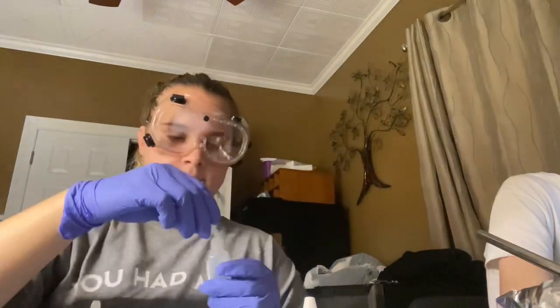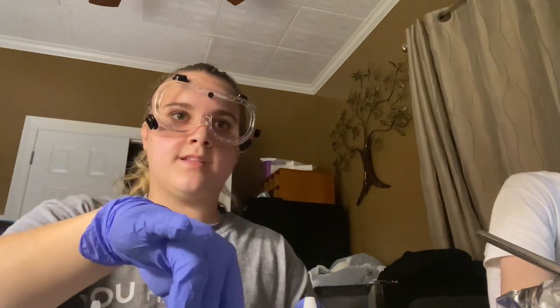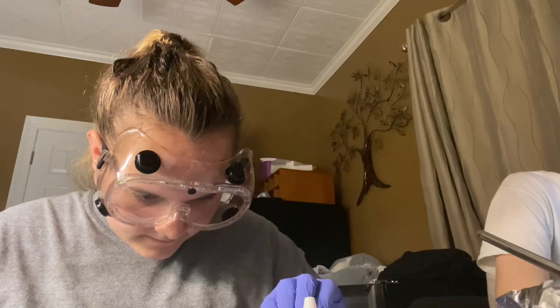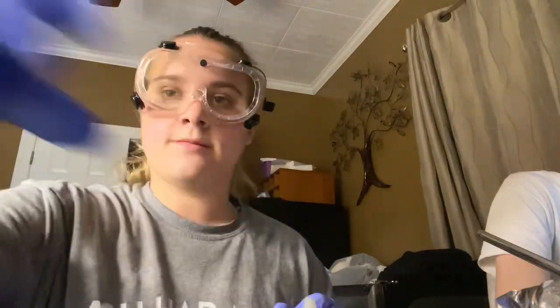Alright. And now we add 1 drop of silver nitrate into 103 and 104. And now I will record the observations.